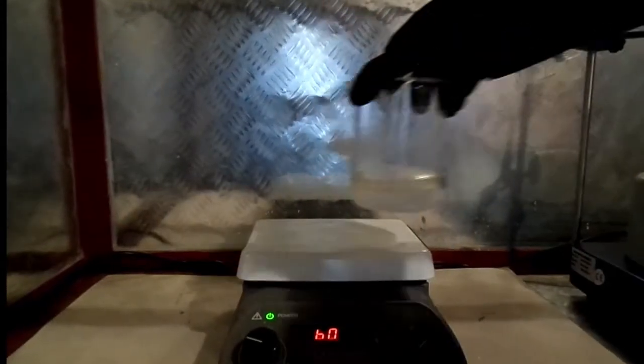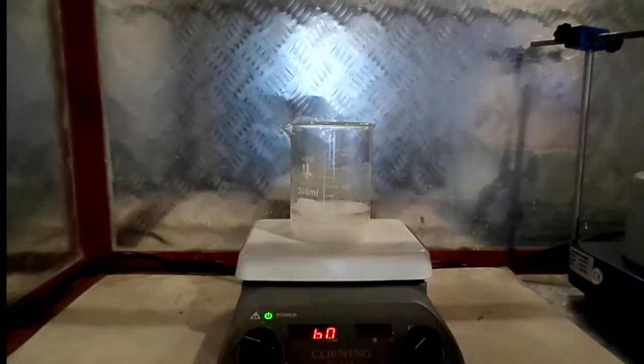I then placed the beaker on the hot plate, added a stir bar and allowed the sulfamic acid solution to stir.